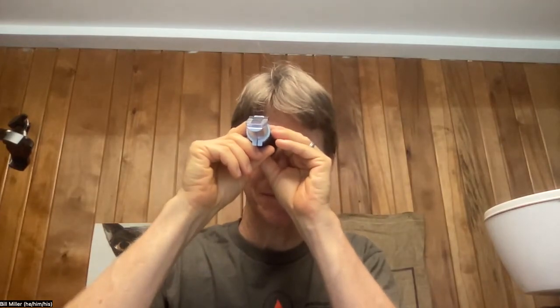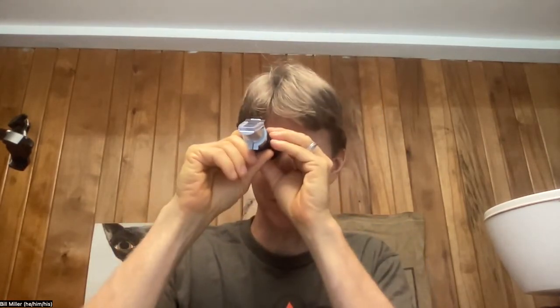Now I'm going to look at it. Sure enough, this is a new one — it reads right at 1.333. You can see, too, where that line is, because you can see the light-to-dark transition. So you can see that it's right — it's actually good, right at the 1.33. You can see the light below it and the dark above.